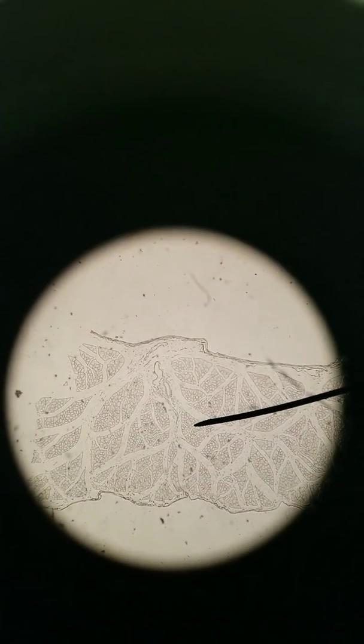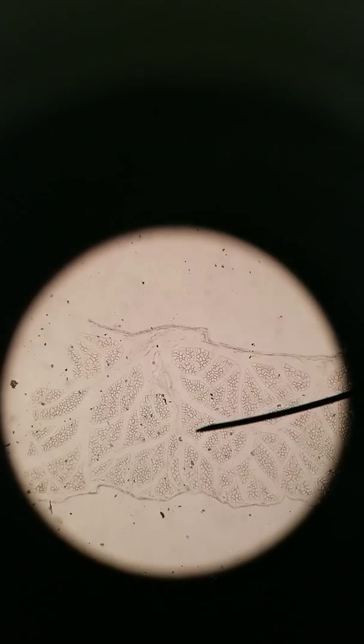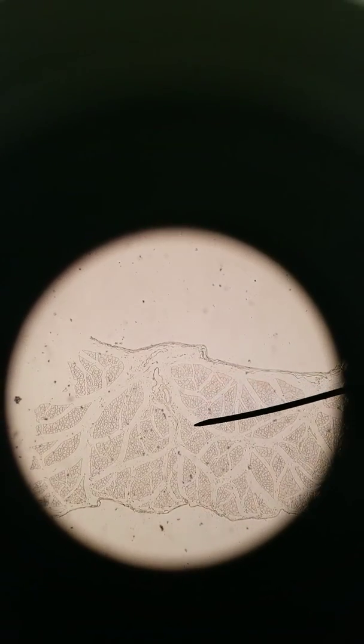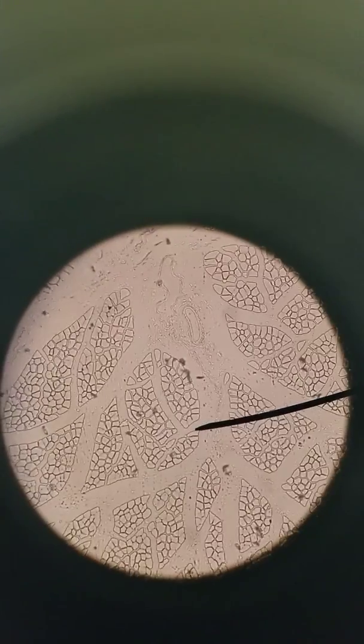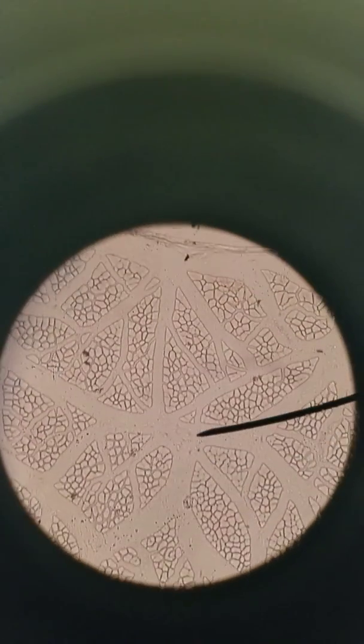So here's a different slide showing the same exact thing. There we go. This is a cross-section of skeletal muscle. You can see the epimysium towards the outside. Some dust there somehow. Get that dust off. There we go. Epimysium towards the outside. You can see the bundles of fascicles. You can see individual muscle fibers. Going to 100x now, you can see that very clearly here. That's skeletal muscle in cross section.